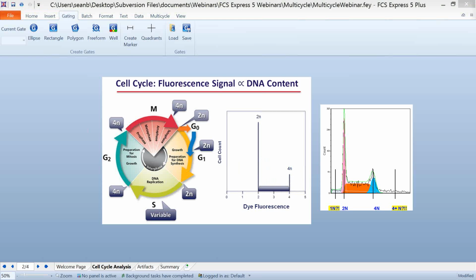But what happens in reality, rather than what you see in this figure, is that in biological samples, the CVs of the peaks are wider than one bin, of course. You can see here with some real data, our G1 peak is actually much wider than one simple line, and our G2 peak here is actually much wider than one simple line as well. The other thing that can happen with biological data is that the 2n to 4n ratio might be significantly or slightly greater or less than 2, the theoretical derived value. And you can also end up with debris, noise, background, or artifacts within the data.